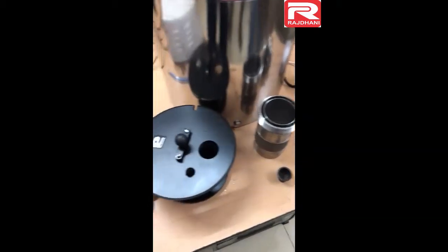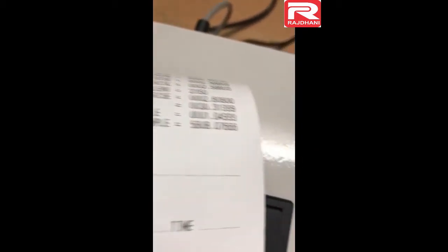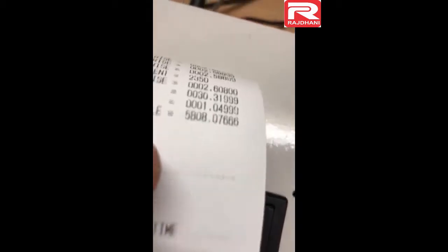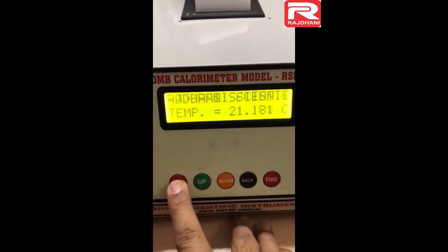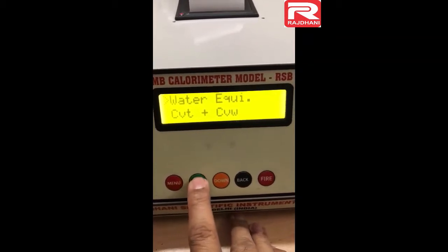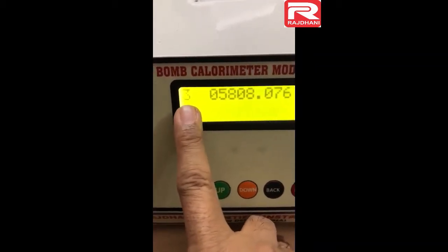The last calorific value was 5808. Now I will press the back button, then the menu button, and go to the memory option. Press menu — the last result is stored in memory location 3, and the value is 5808.